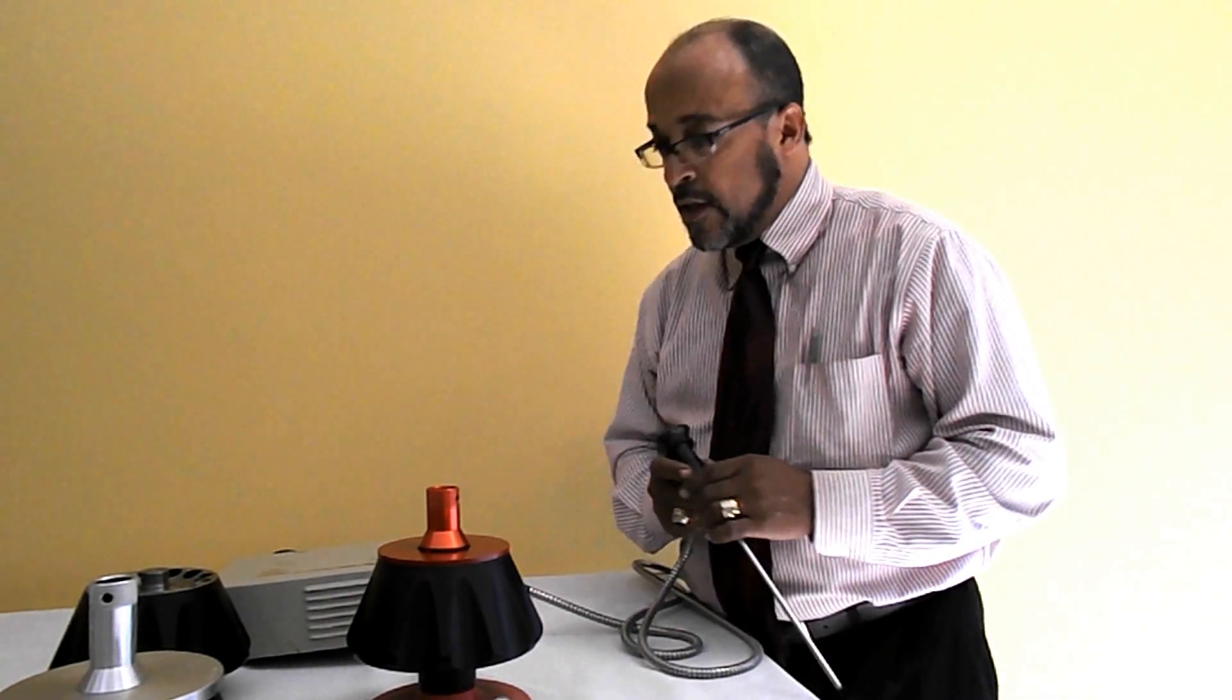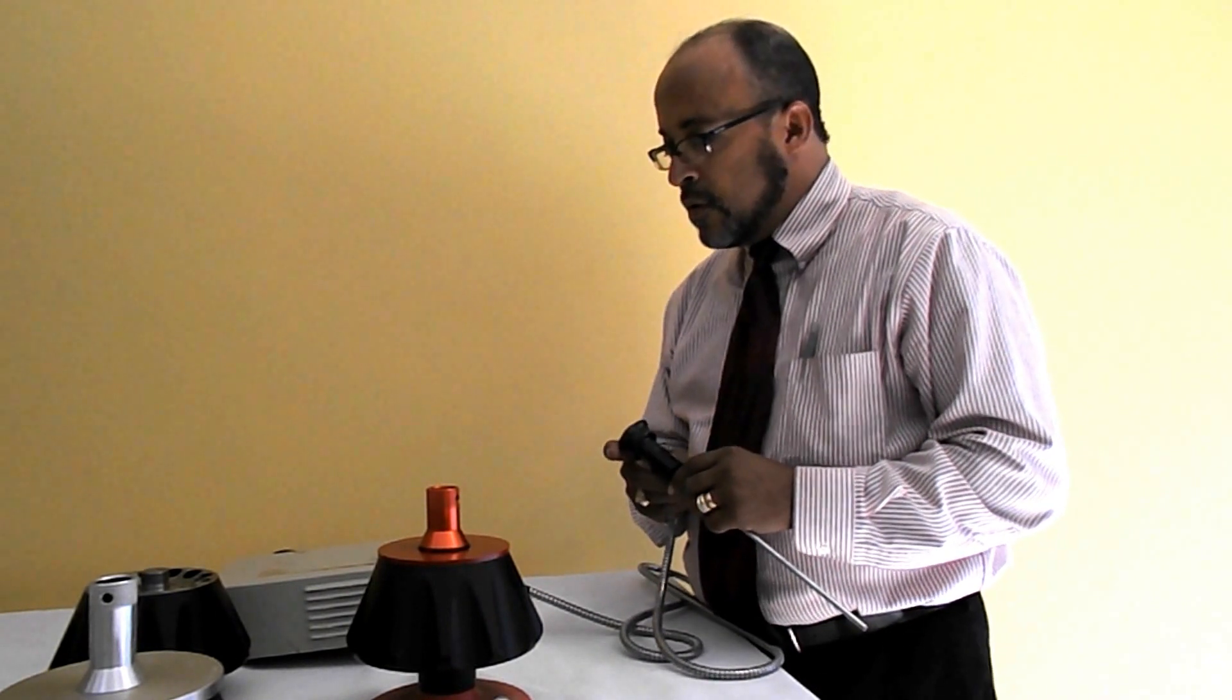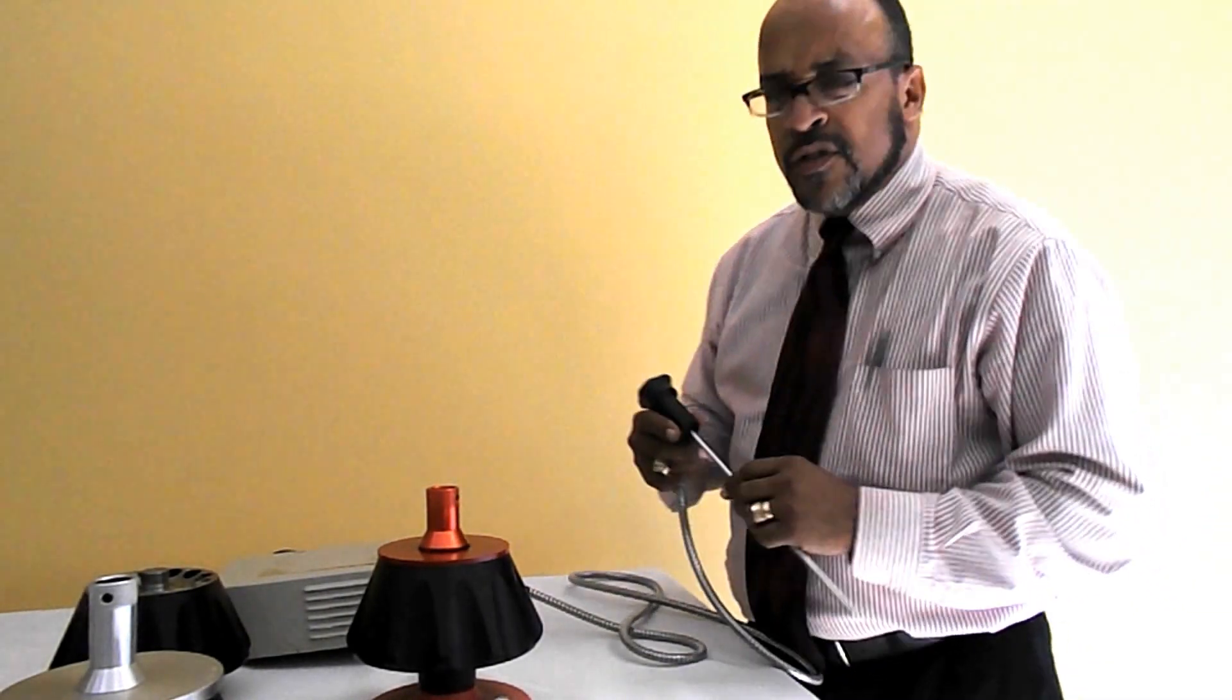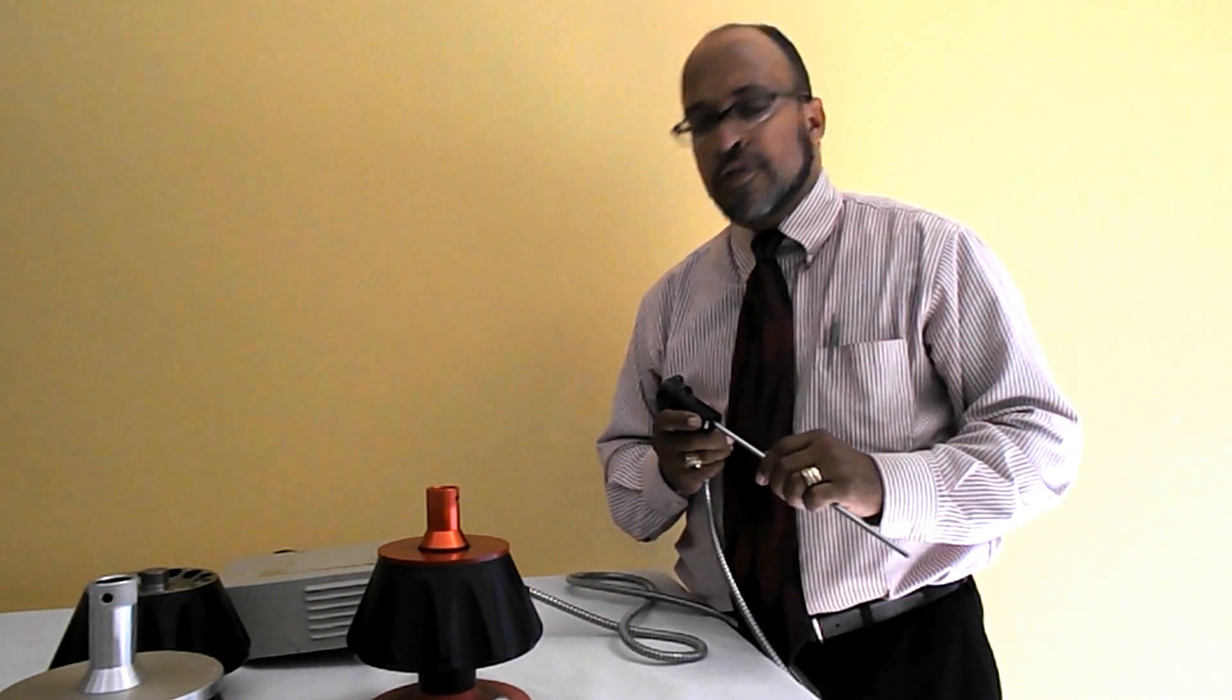We find with a lot of rotors improper cleaning and usage. This will cut down on the life of your rotor and possibly could cause catastrophic rotor explosion in your centrifuge. So your rotors need to really be looked at periodically depending on the usage.